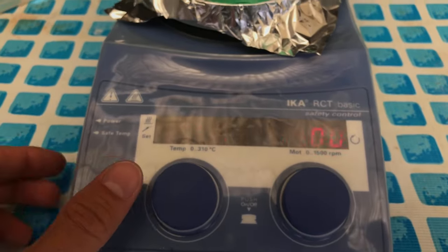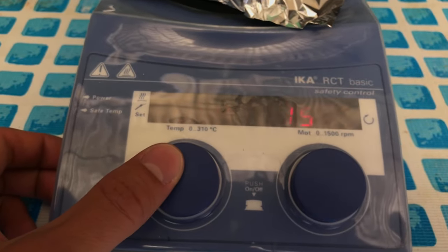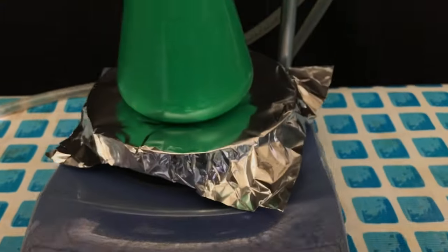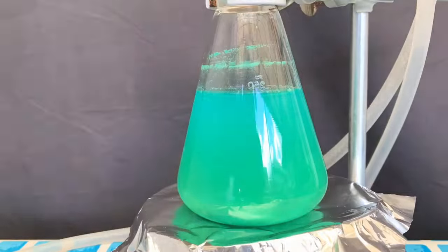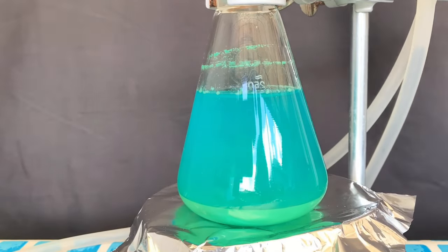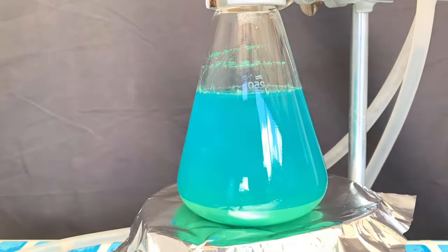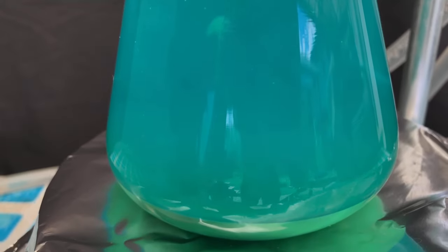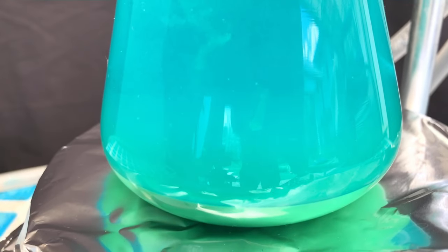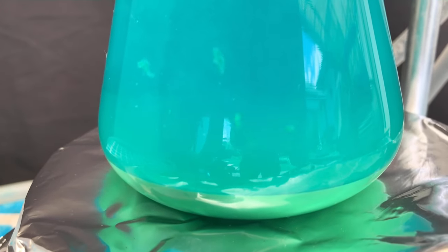Heating and stirring were turned off, and the contents of the flask were allowed to cool back to near room temperature. Because Paris green is poorly soluble in water, you are looking at a suspension of Paris green in water and not a solution. Therefore, after turning off the stirring, it quickly settled down. As the hot plate was still hot, some steam was being formed and I filmed this interesting phenomenon. It's like smoke rings made of Paris green.